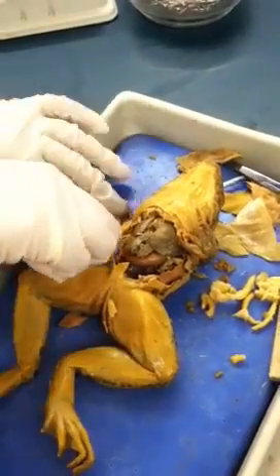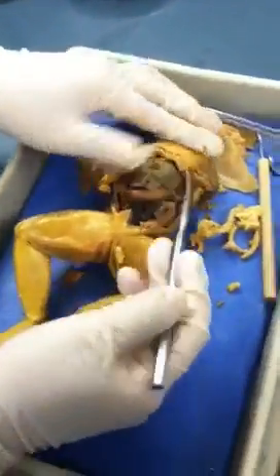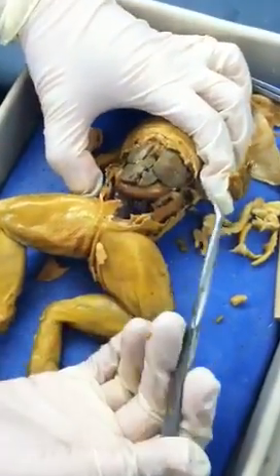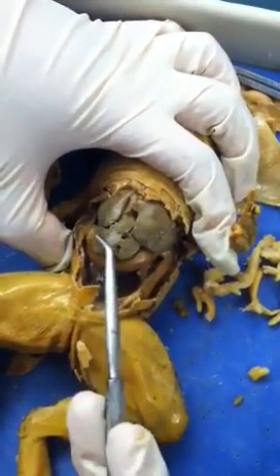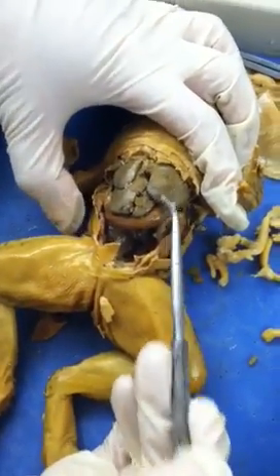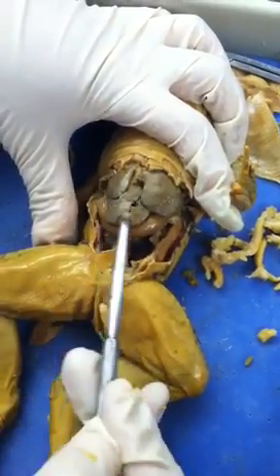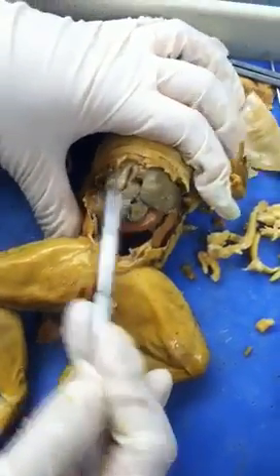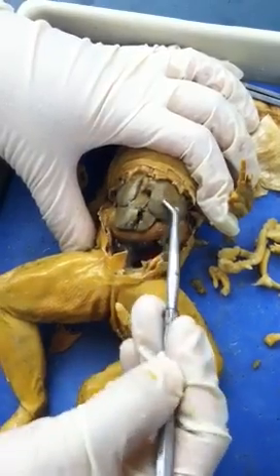For the frog, we focus on the internal structure. The first organ you see is the liver — similar to a fish but with different lobes. You can identify it because the texture is kind of different from other organs. They have three lobes, so that's the liver right here.